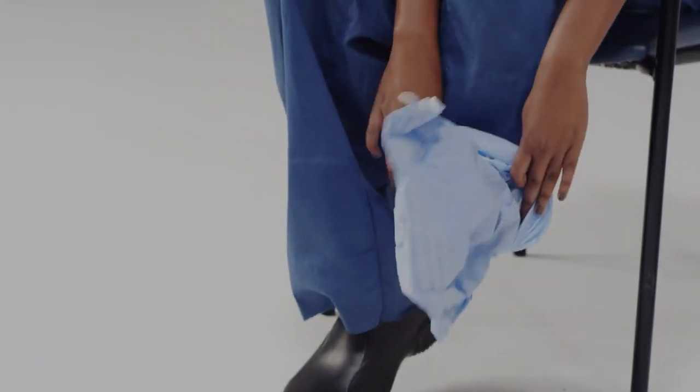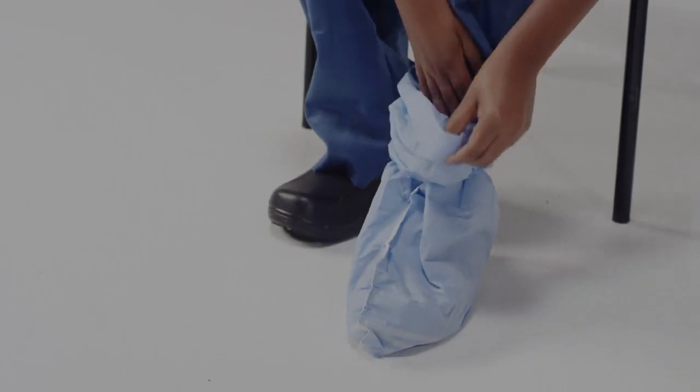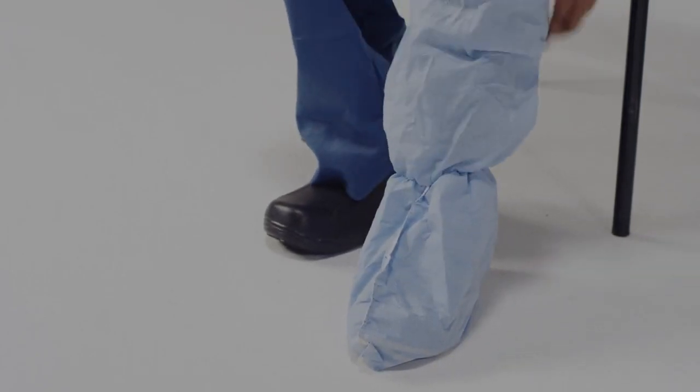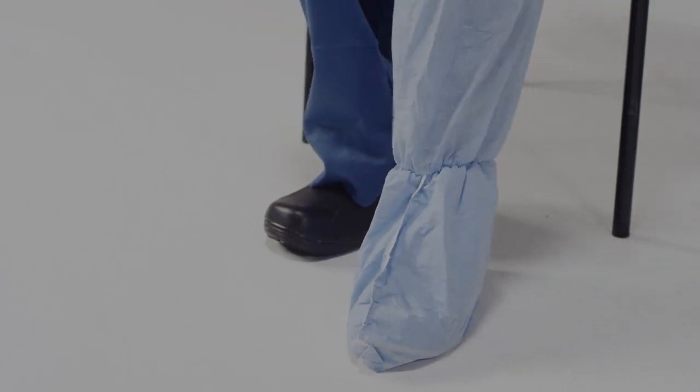Once you get the booties on, we want to make sure they're secured around your ankle and your calves. Make sure that all areas of the foot are covered and the boot covers are snug over your ankle and calf.